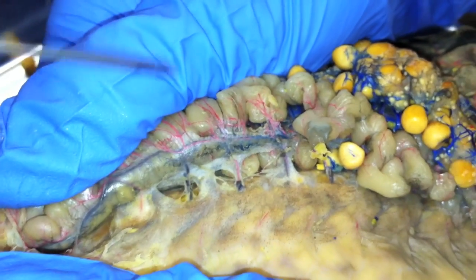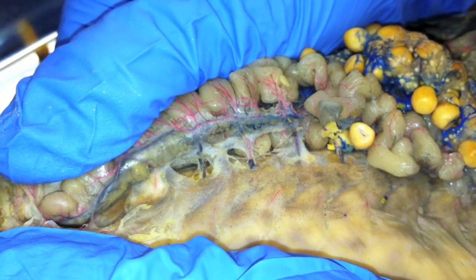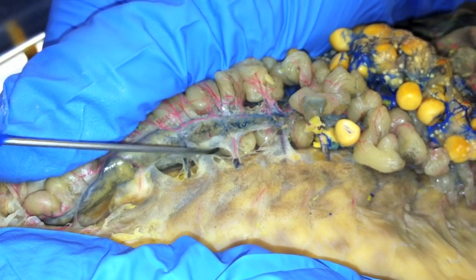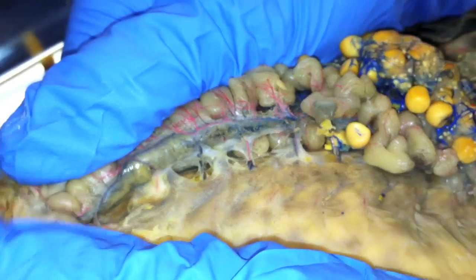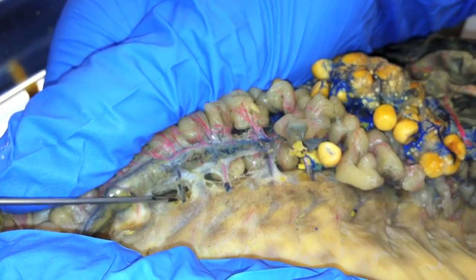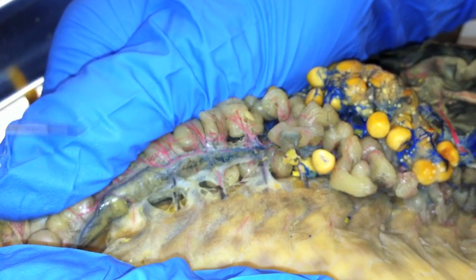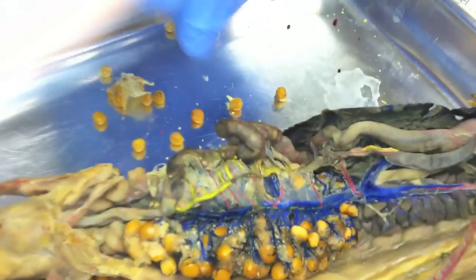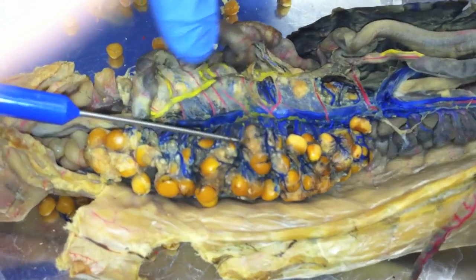We got the renal portal veins that run along the kidney. Renal arteries come up to it. Then we got the efferent renal veins — they're almost purple, coming up, they look like a renal artery except a different color. For the gonadal arteries, this is a female, so we have ovarian arteries and veins. They're just running along — you can barely see the pink in there.